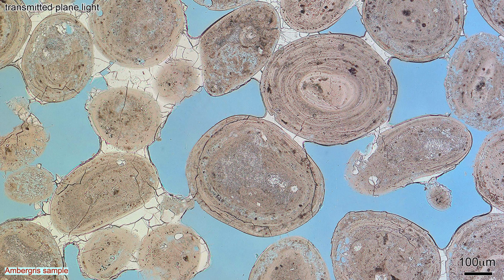The first thin section shows only ooids arrived at the Ambergris depositional site, where they were partially cemented by transparent calcite cement. The cement's crystals occur predominantly between closely spaced ooids, but the small gaps between ooids by the brown asterisks are cement-free.